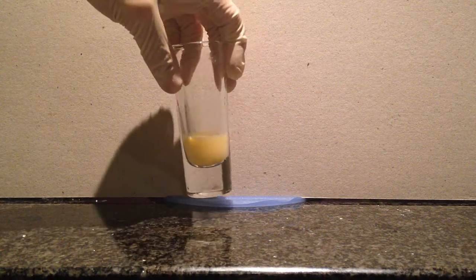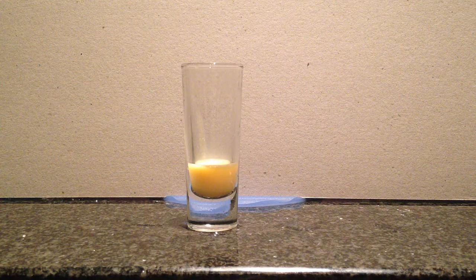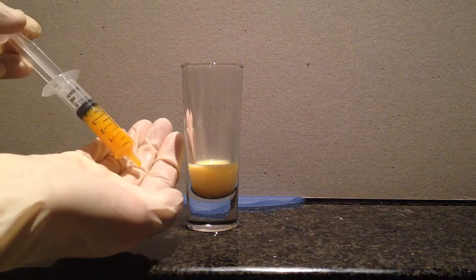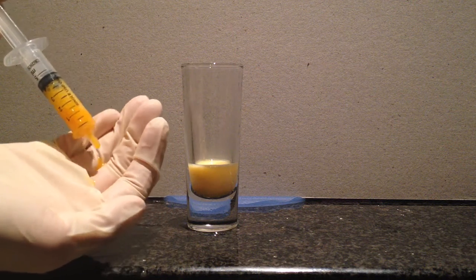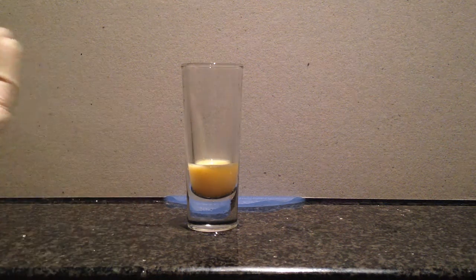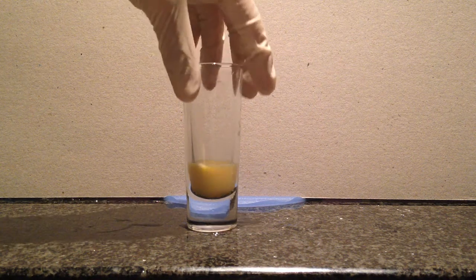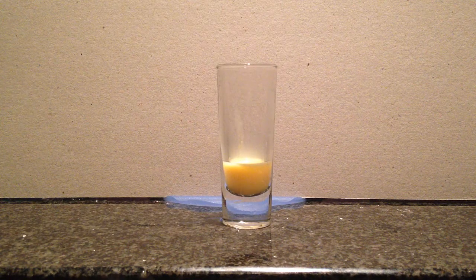Okay, well, it definitely has gone a lot lighter than when it was. That's what the color was. Can you see it? Okay, yeah, that's the color. It has gone lighter. There could be bubbles, there could not be bubbles. It's too small. No, I can't see any bubbles popping or anything.